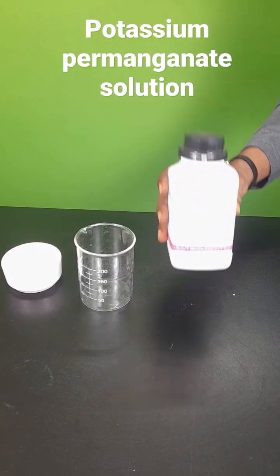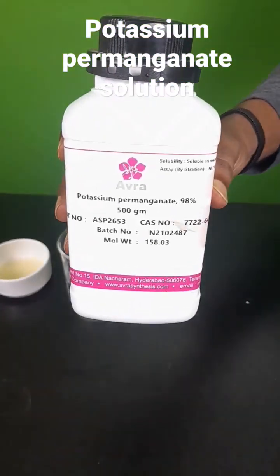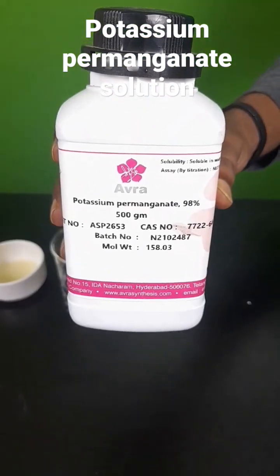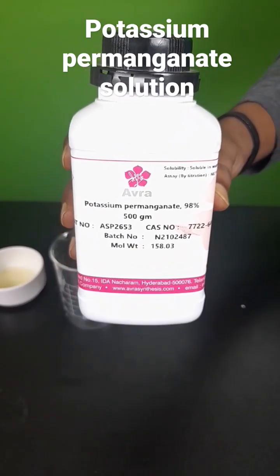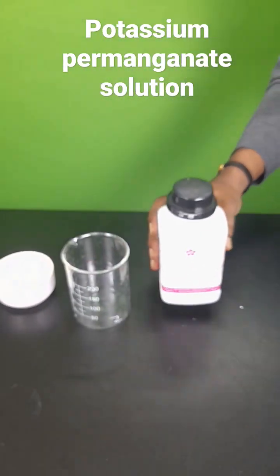We all are aware of potassium permanganate, KMnO₄ — it is a strong oxidizing agent. Now we are going to witness the strong oxidizing nature of KMnO₄.